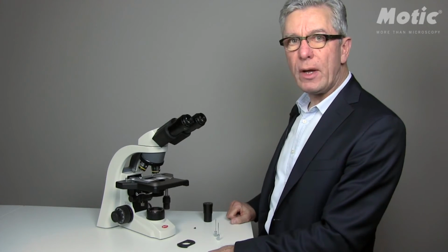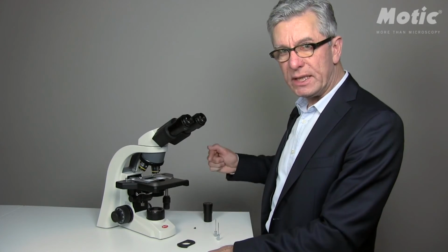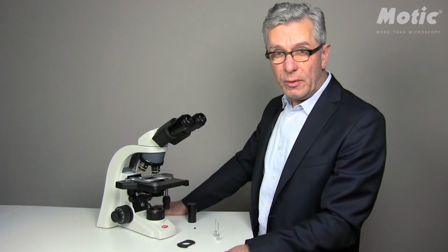If you want to change to another objective with another phase ring size, you have to follow this procedure from the very beginning. I hope this video was useful for you.